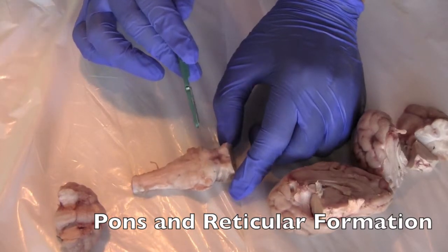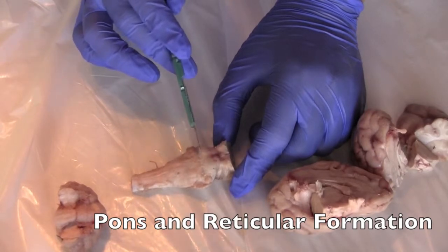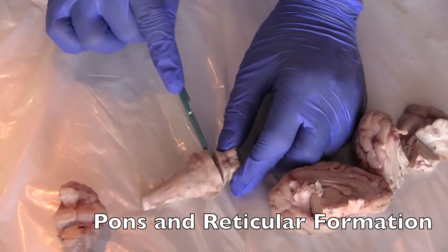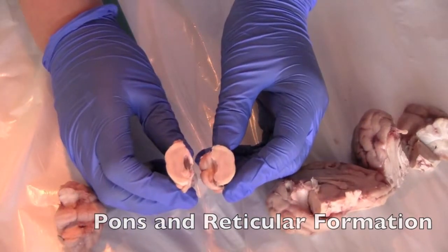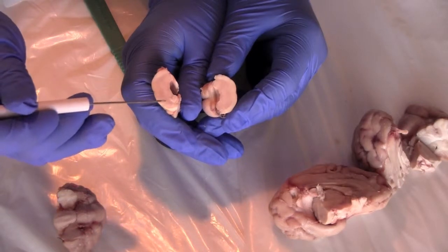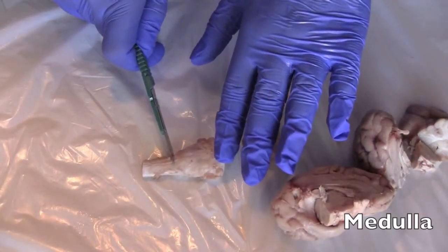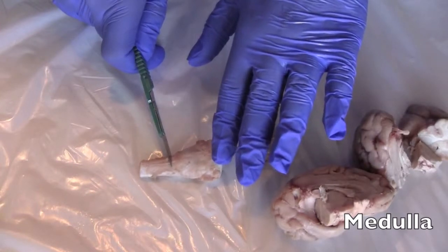And the pons is kind of like a four-way intersection in that it's a crossway for multiple parts of the brain. By cutting through the pons, you're going to reach the reticular formation. So these dark semicircles is the substantia nigra that degenerates when people have Parkinson's disease. So here we have the medulla again, which deals with the autonomic functions of the body like heart rate and breathing.